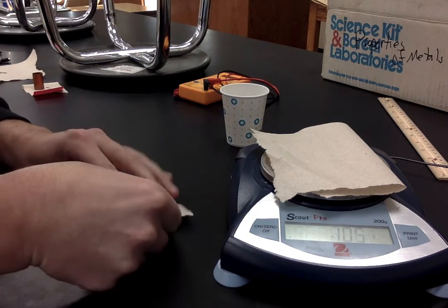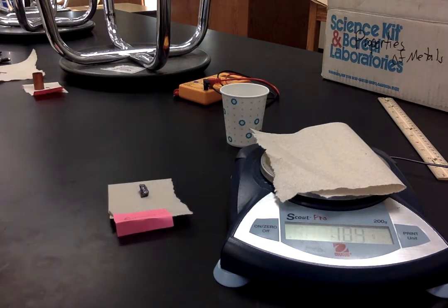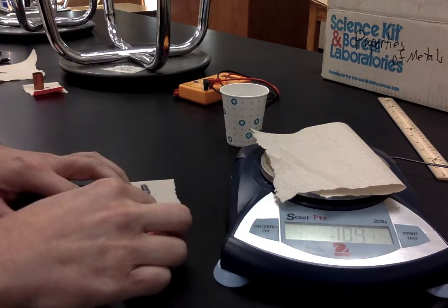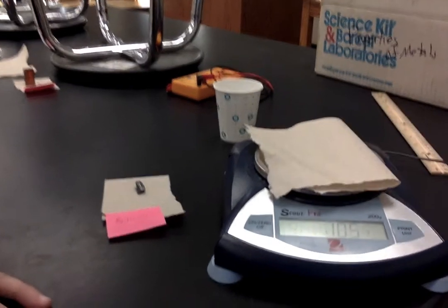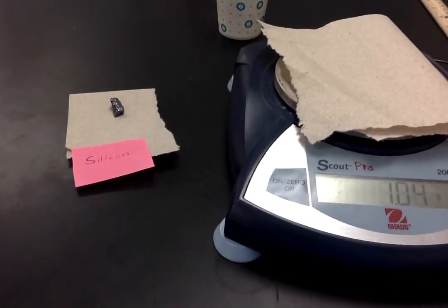Can you read that? Yeah, let's go like that. That might be even tougher to read. Maybe if I got more on top of it. There we go. Silicon.